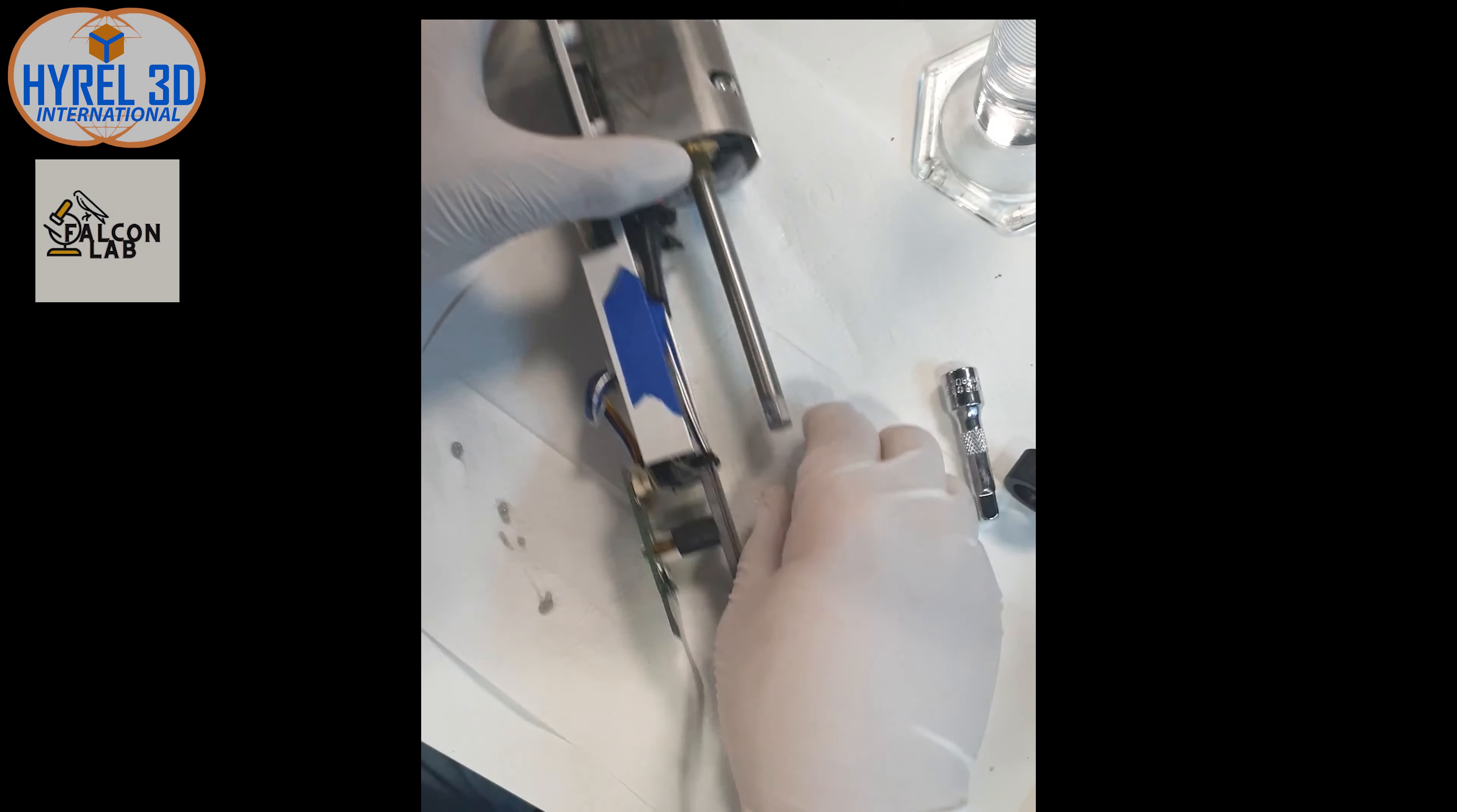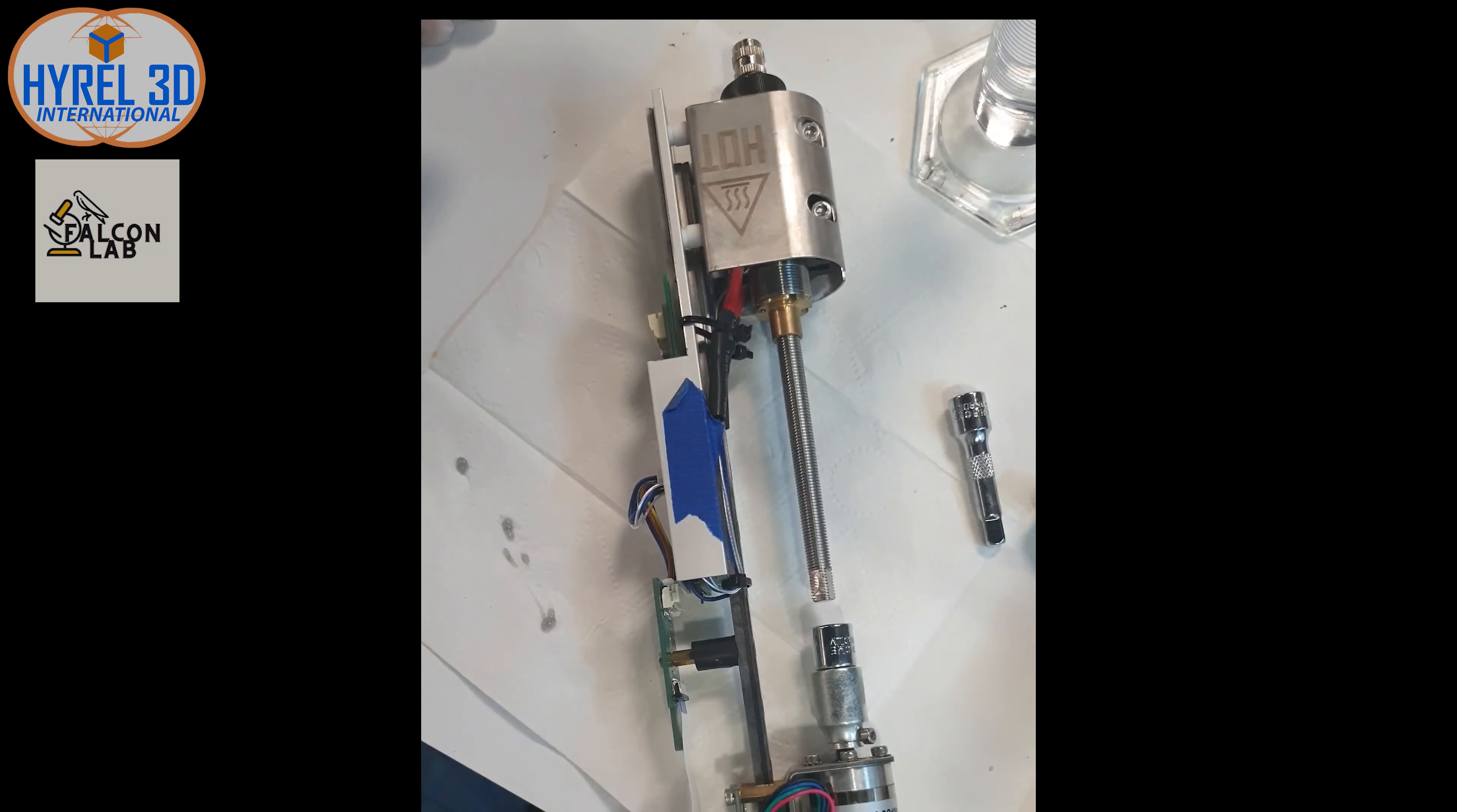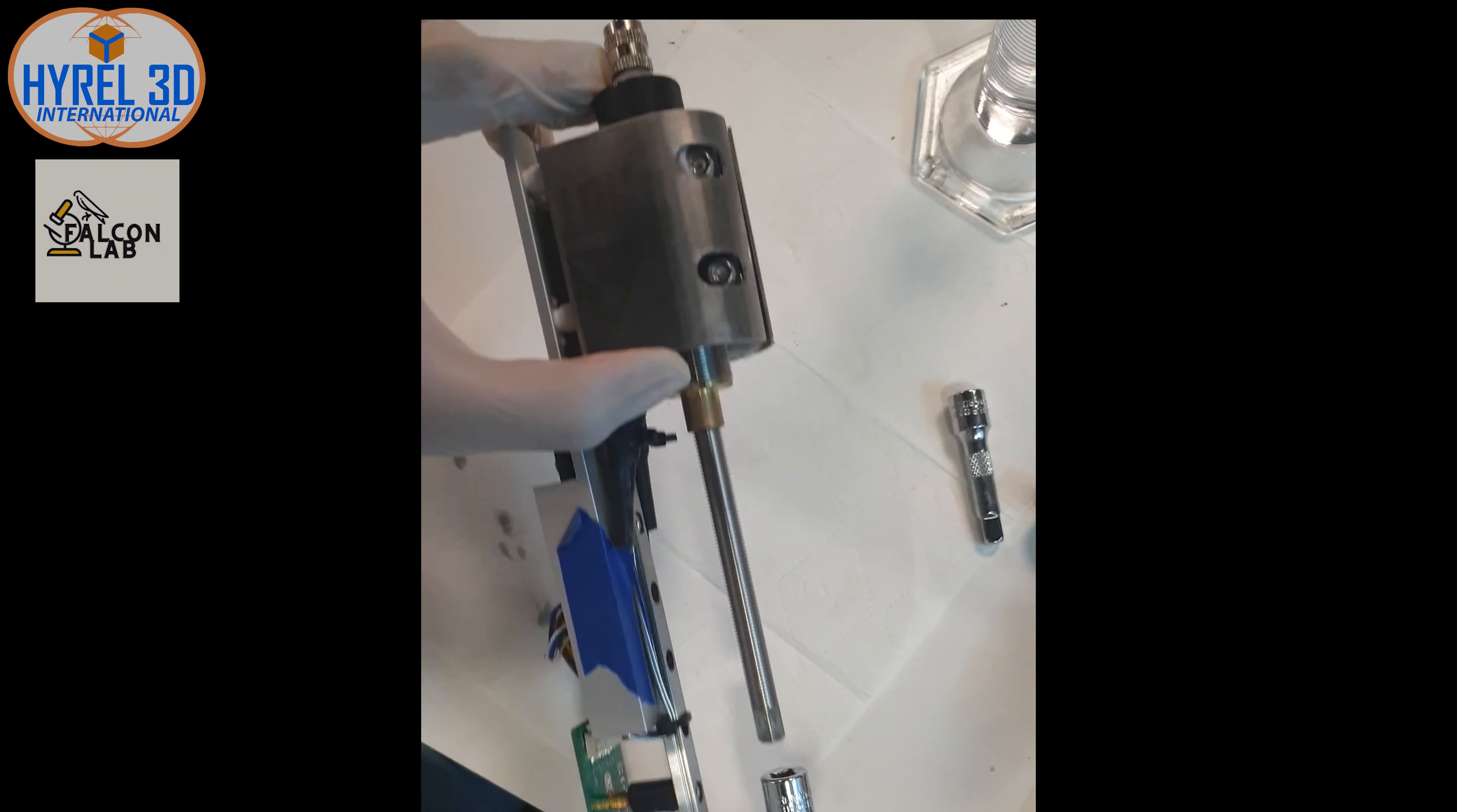We will remove the black cap to load the cartridge into the printer. Always remember to close the black cap after loading the cartridge.